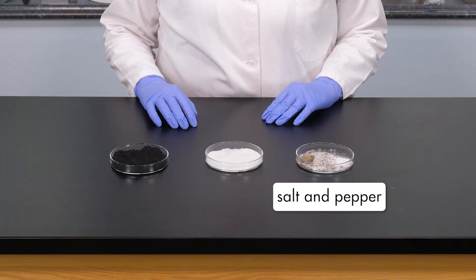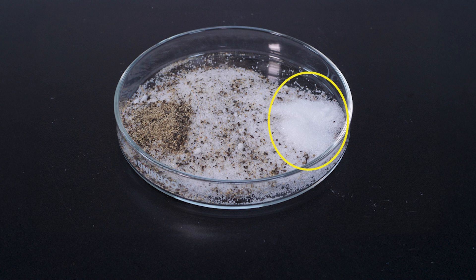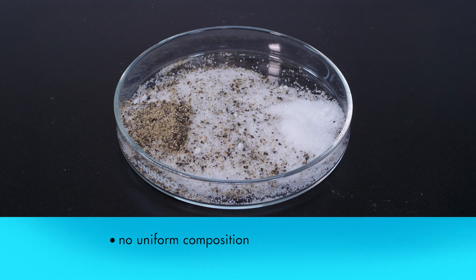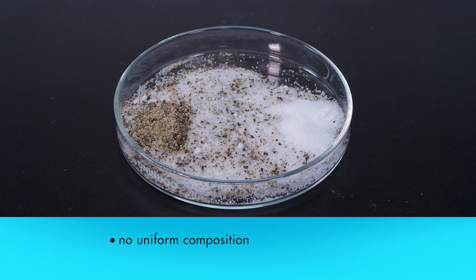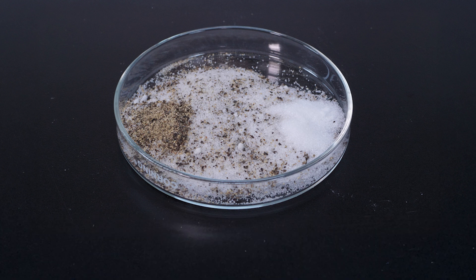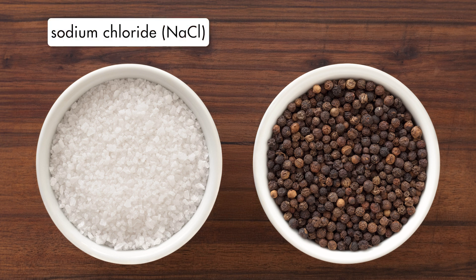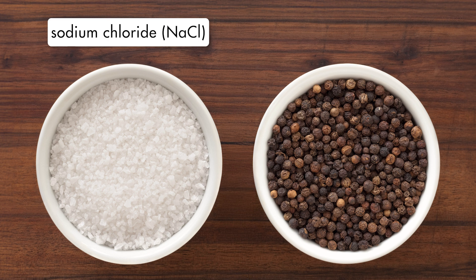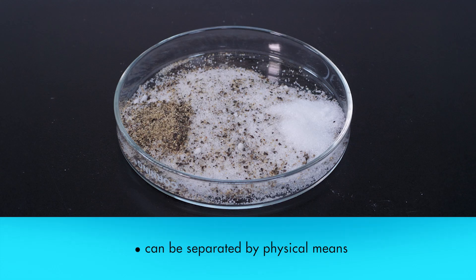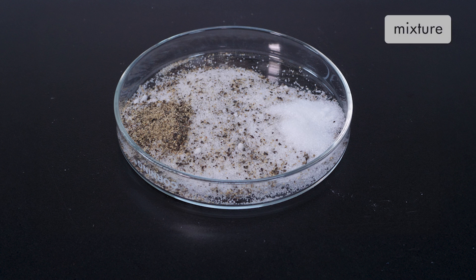The third sample consists of salt and pepper. Since this sample has a greater concentration of pepper in some areas than others, we see that the sample does not have a uniform composition throughout. If we test the chemical properties of each portion of this sample, we find that the sample does not have the same chemical properties throughout. If we perform a chemical analysis, we discover that it contains two components: sodium chloride, which is an inorganic substance with the chemical formula NaCl, and black pepper. These two components can be separated by physical means. This sample is not a pure substance—it is a mixture.